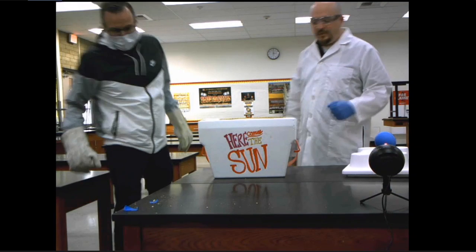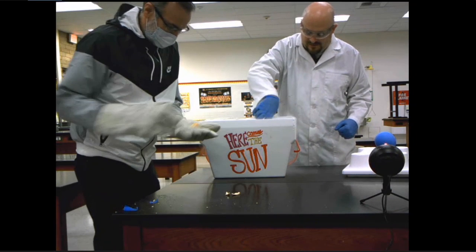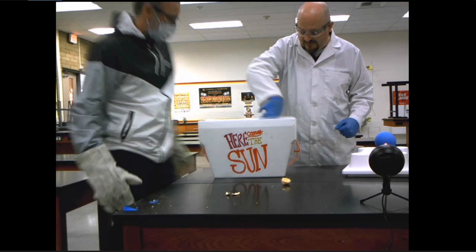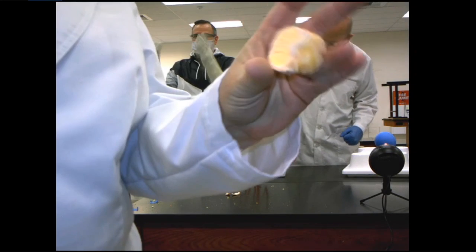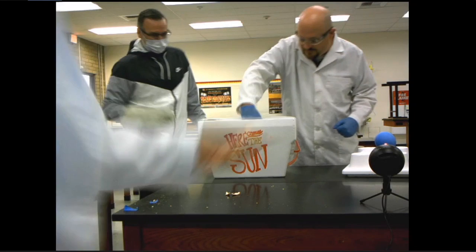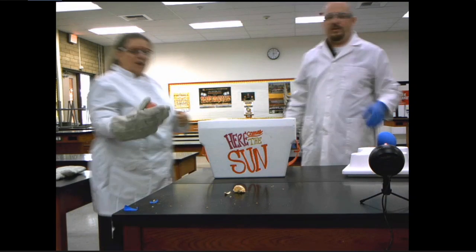Wow. That was a soft, squishy tangerine a few minutes ago. All right. Yep, completely frozen. So you can see. All right, who's next? Anybody else? You can see. All right, guys. Look at the apple already cracking. Oh yeah, right. Here we go. Make a big mess.